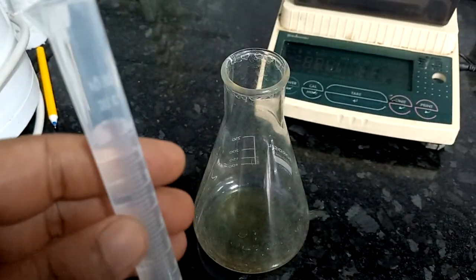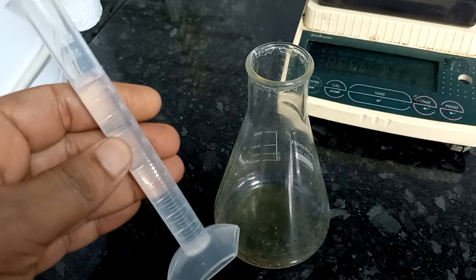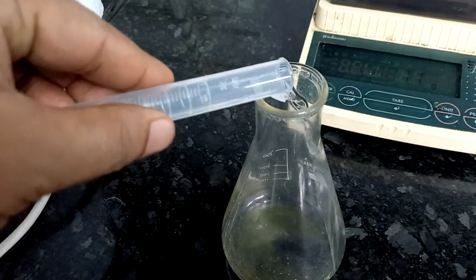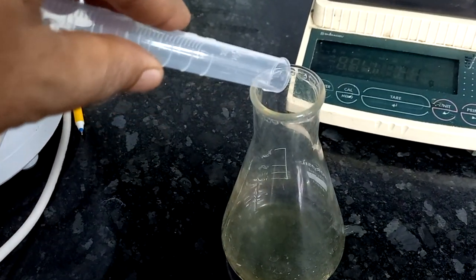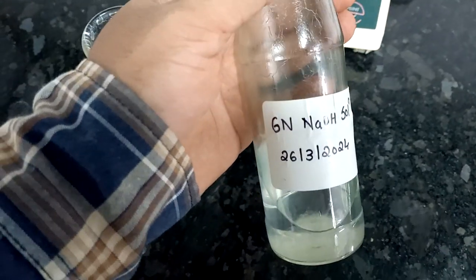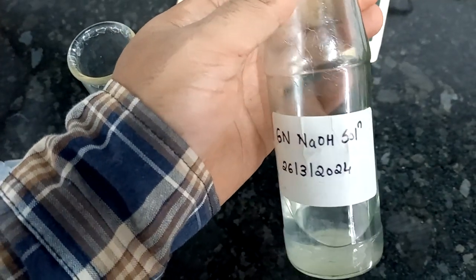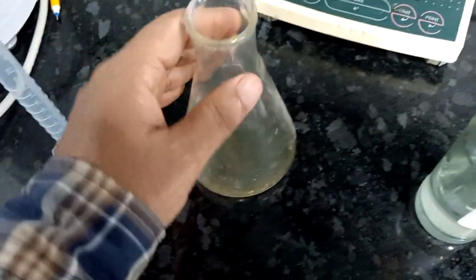Add 10 ml distilled water into this sample. Mix well and also add 0.9 ml 6N NaOH solution into this sample.